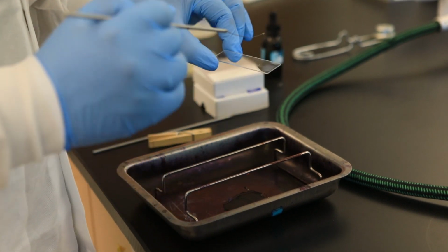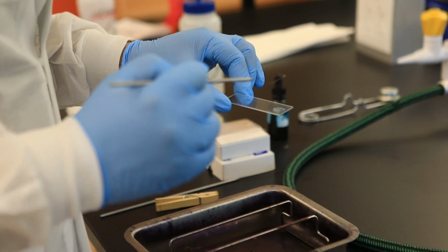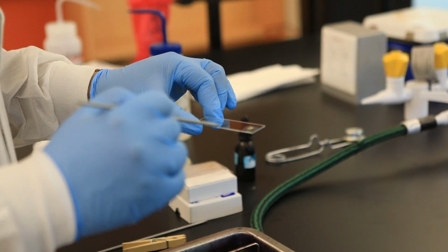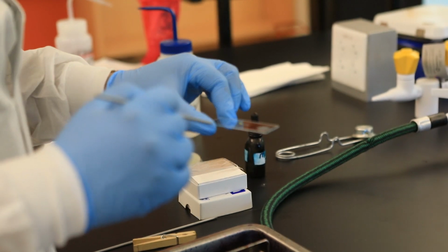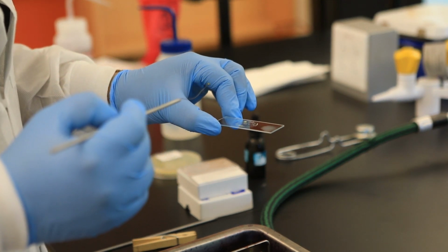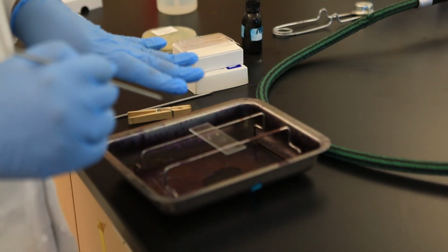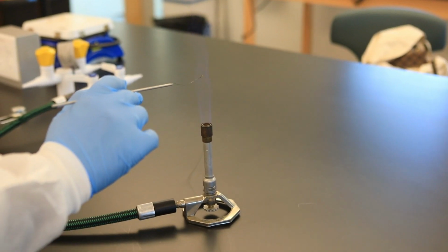Okay, and what you do to create the bacteria smear is that I lift up the loop. I don't drag it. I lift up the loop, and I'm going to mix it one more time, but I lift up the loop, and then I go into the middle of the slide, and I start making these small spirals, and then the spirals become bigger. So they're like small semicircles, and then the circles become bigger, okay? Once I make my smear in the middle, then I'm going to re-sterilize the inoculation loop.